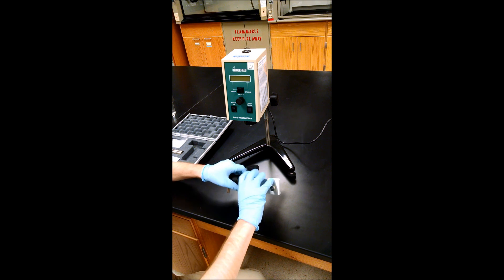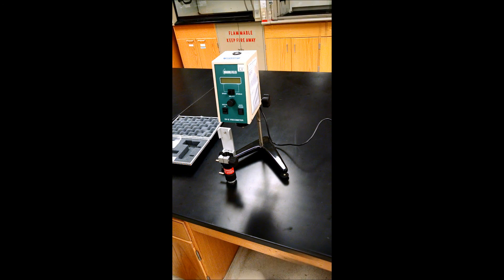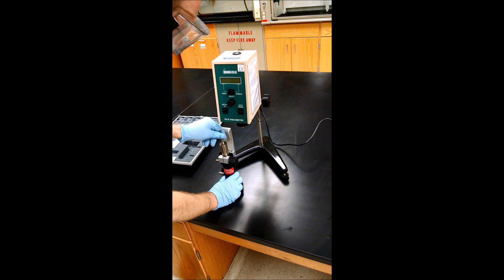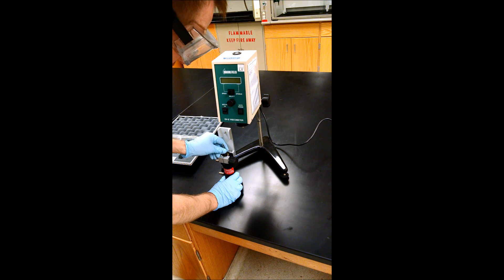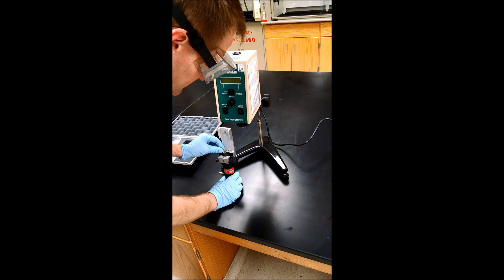It's not as easy as it looks. Once you've poured the 16 milliliters in, you can gently insert your spindle until it's completely covered by the liquid. Make sure there are no bubbles.